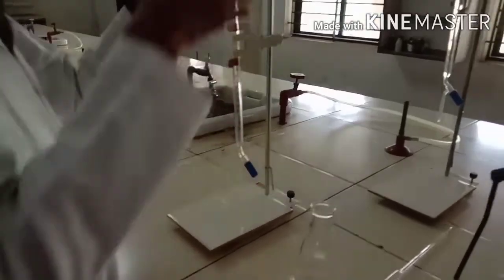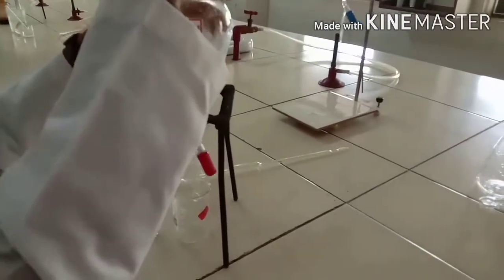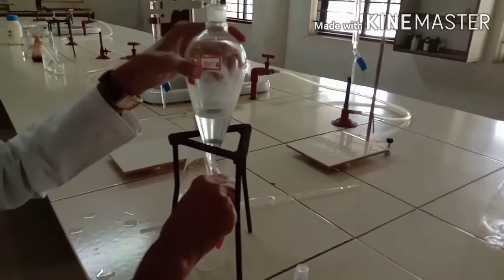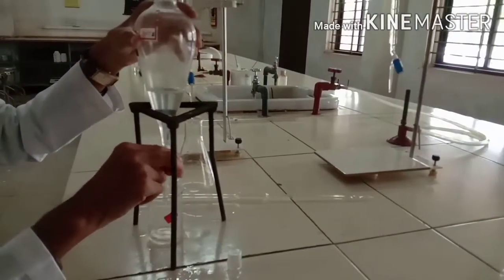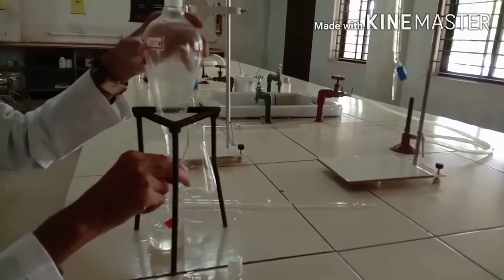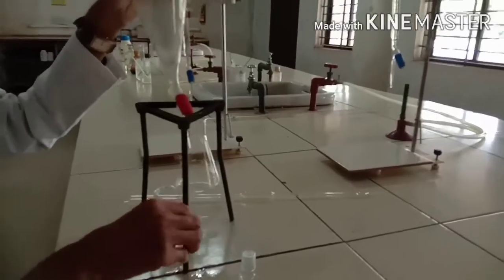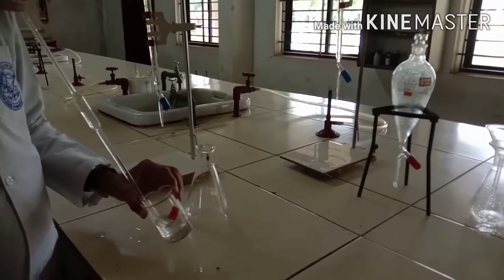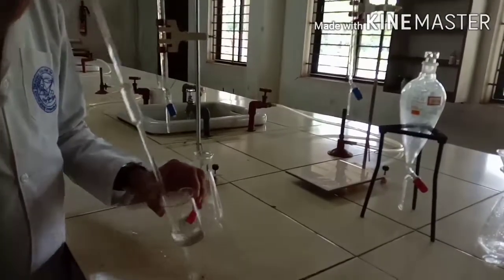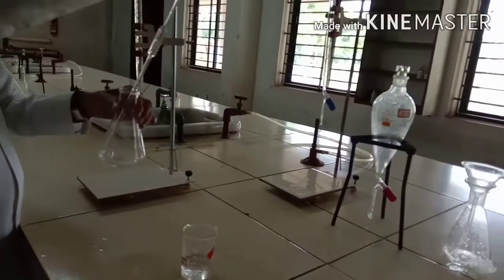For the organic layer titration, use 0.5 normal sodium hydroxide since the benzoic acid concentration is higher there. Fill the burette with 0.5 normal sodium hydroxide. Remove the stopper and transfer the entire benzene layer, which is the organic layer containing benzoic acid. Take 10 ml of the organic layer using a bulb pipette. Be careful — benzene is carcinogenic in nature.